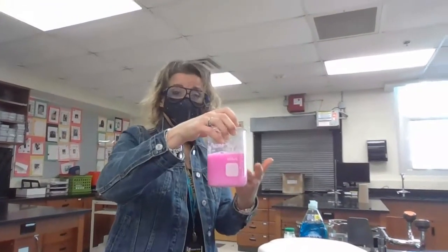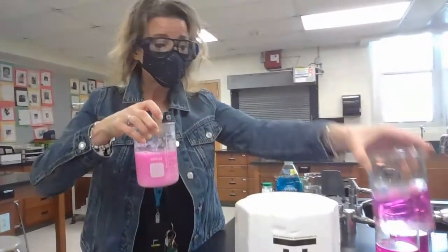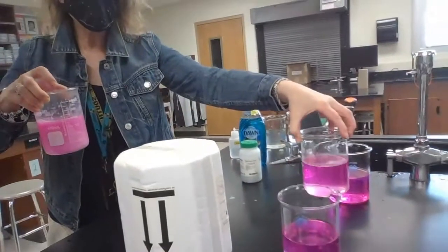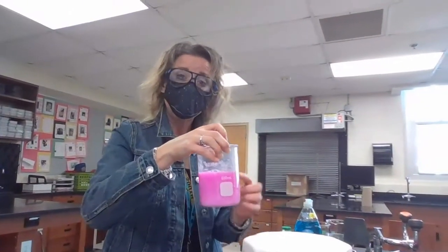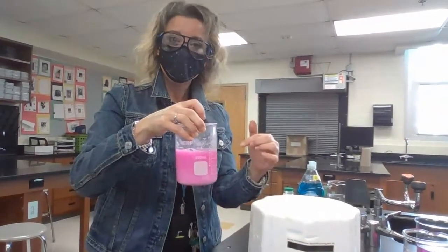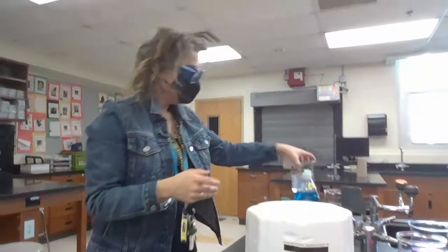But also, it turned pink, just like all of the other beakers that we use. They're all lined up right over here. So just like the other metals, calcium reacted with the water to produce a base, to produce something new. And that's what turned the phenolphthalein pink. Remember, the phenolphthalein was clear when it was in just the water alone. Okay, now we're going to look at our last element, and we're going to look at copper.